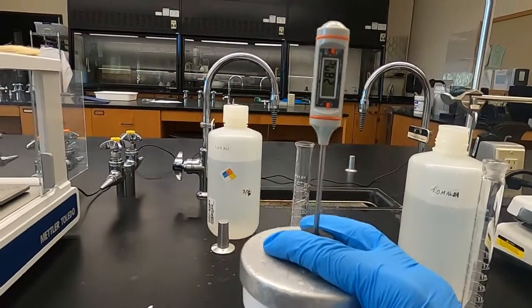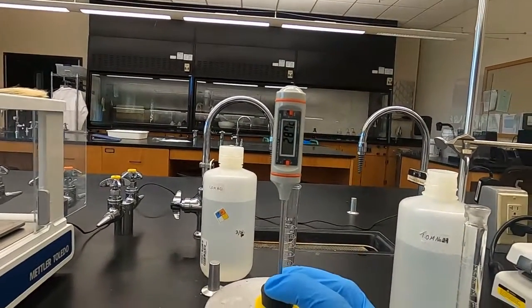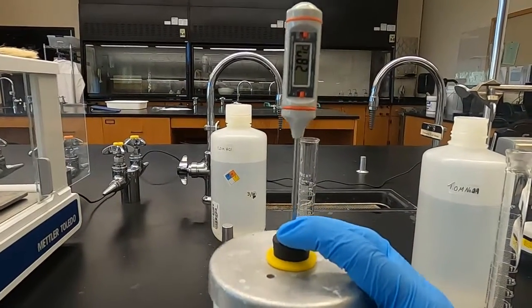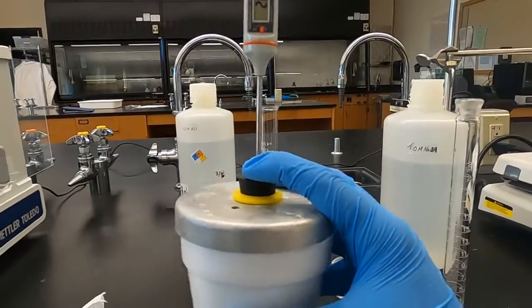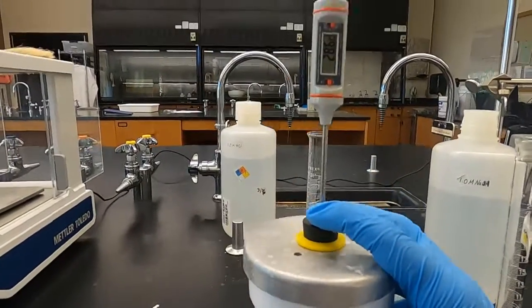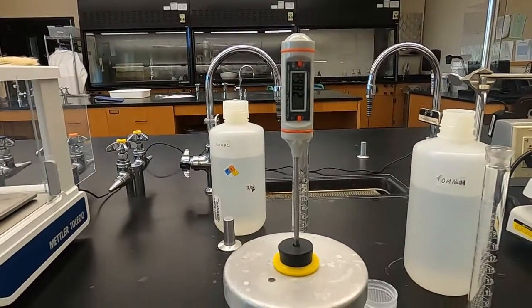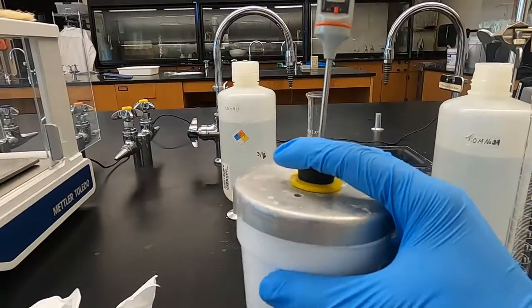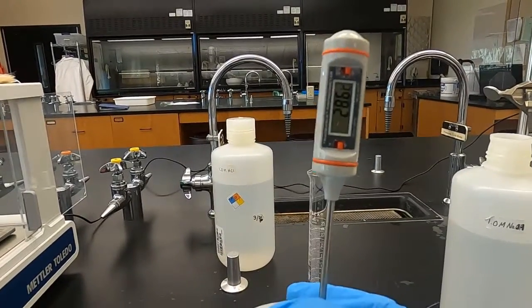Now it's just dropped a little bit there. Let's see if that's our end, but 28.7, unless something else happens with the increase. That's what we're looking at for our final temperature. As I'm waiting for this, I'm thinking about prepping the cleanup, which you guys wouldn't have to do since you're at home watching this or wherever you may be. But if you're in the lab, there's a lot. Just make sure we're putting it back to normal. Got those spatulas, all the graduated cylinders. Again, it's hovering between 28.6 and 28.7, so I'm gonna just give it a little bit longer.